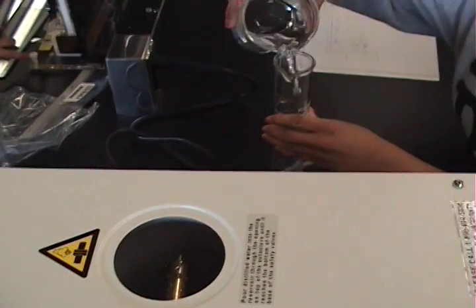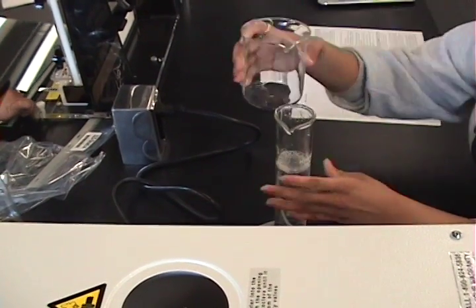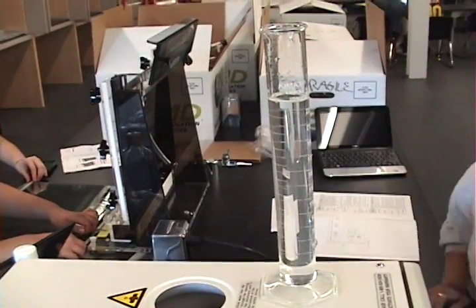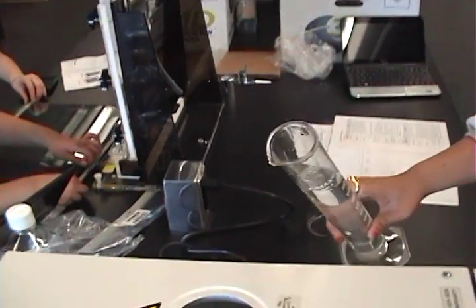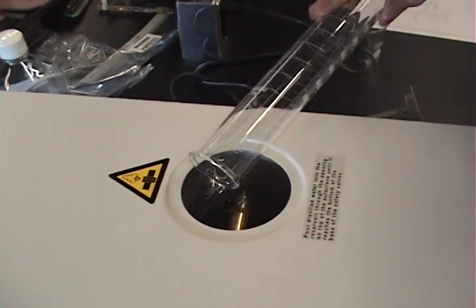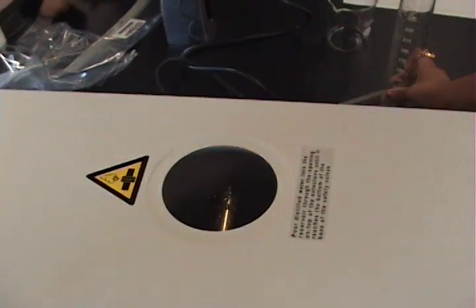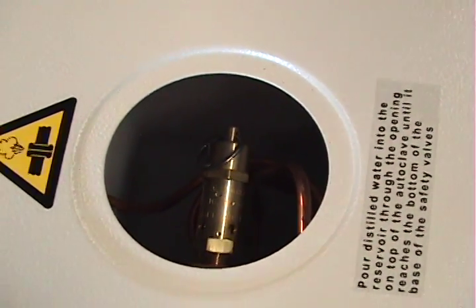We will re-measure the water because the cylinder only held 200 ml. Once again, pour it into the reservoir. Now close the reservoir — it is now filled with 450 ml.